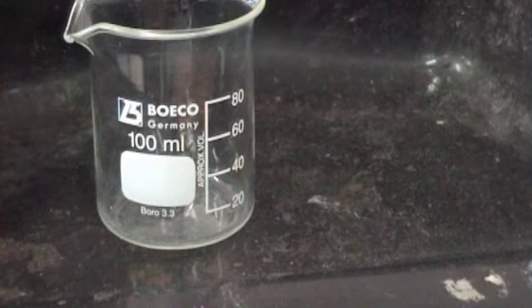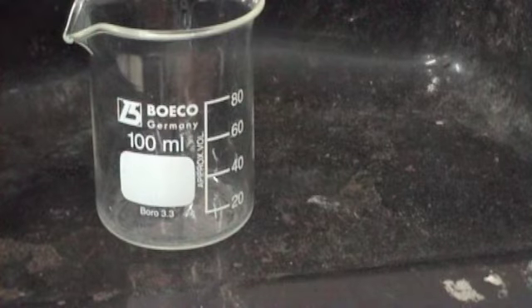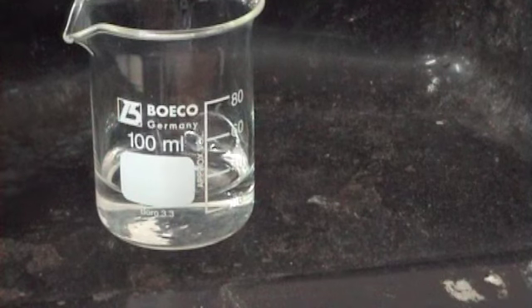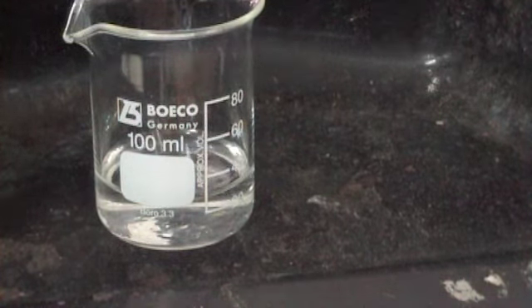Smashed and broke. Yeah? Okay, so we're going to do them in the order. So we think this first one is magnesium sulfate, right? So what's the first thing we're going to always add? NaOH solution, okay. What are we expecting to see? White ppt, okay.